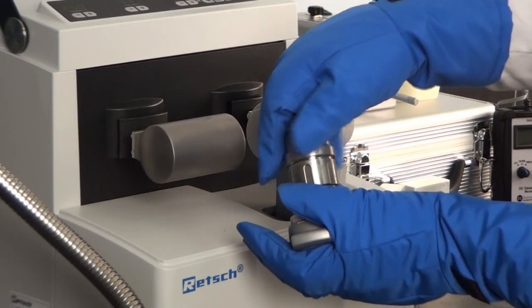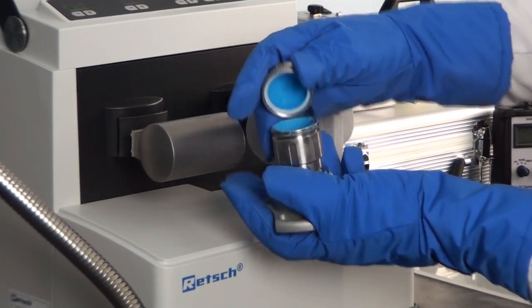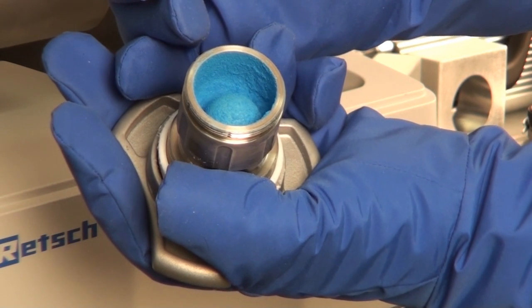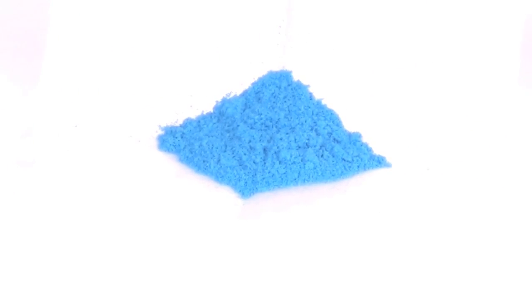When this process is complete, the technician will wait for the instrument to warm up and he will take the vessel off. Here is what your sample looks like before. Here is what your sample looks like 45 minutes after.